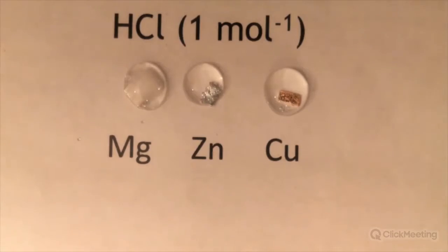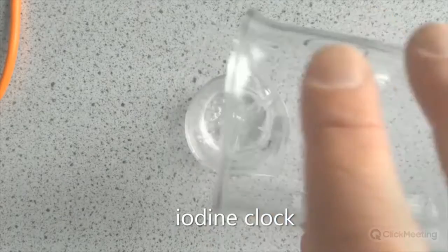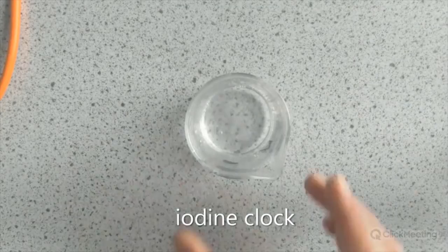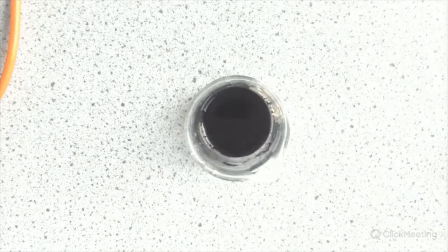The next experiment is coming up, which I think is the iodine clock. So iodine clock is one of my favorite demos. You have sodium metabisulfite plus starch added to potassium iodate. And what happens is the iodine is released all at once and reacts with the starch in a moment or so to form a blue-black complex.